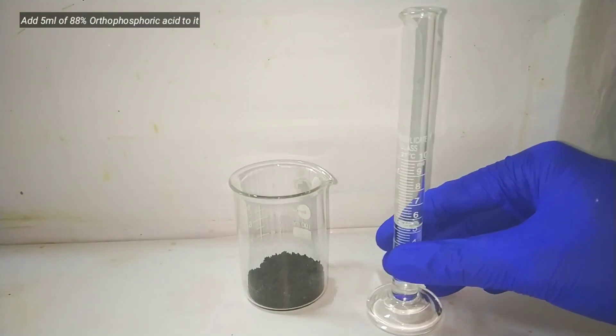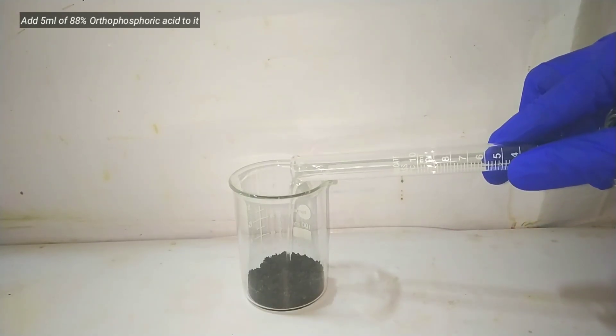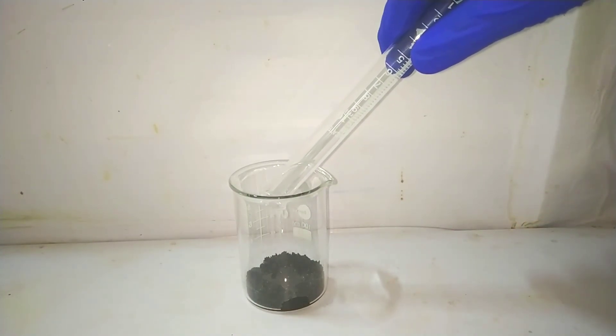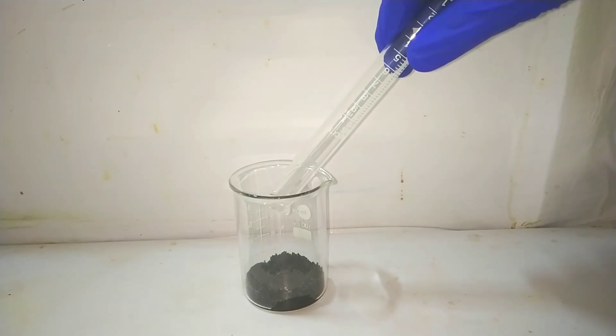5 milliliters of 88% orthophosphoric acid was taken in a graduated cylinder and was transferred into this beaker.